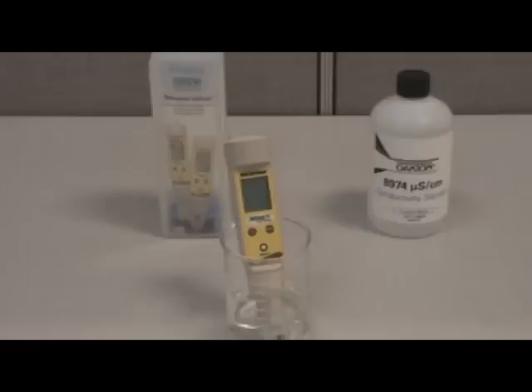When choosing a calibration standard, be sure it is within the specified range of your tester. This information is available in your instruction manual. In our calibration, we use the standard 8,974 microsiemens, which is equivalent to 7.60 parts per thousand. Choose the TDS value off the label on your standard according to the type of samples you will be measuring.